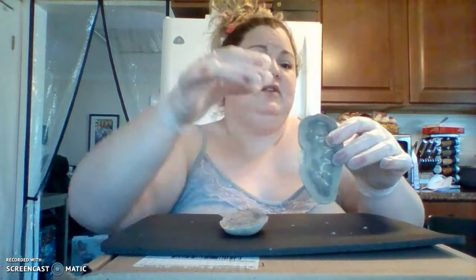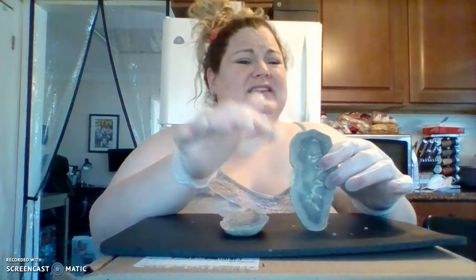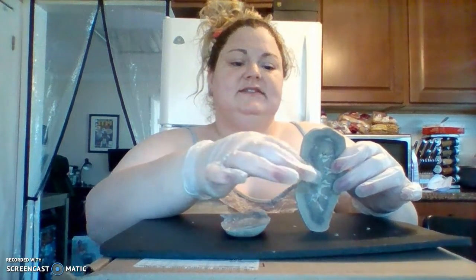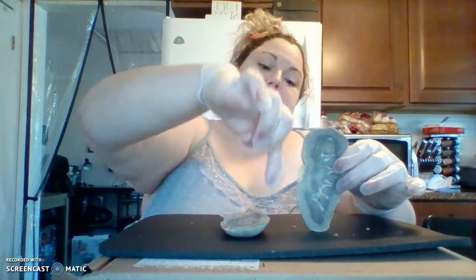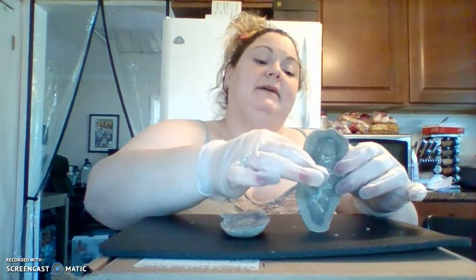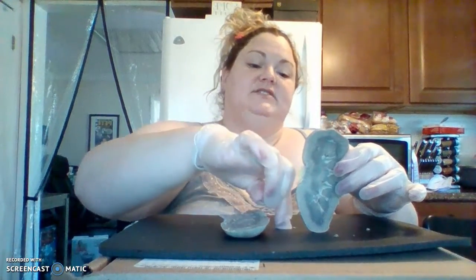I'm just not really quite sure if I cut deep enough to actually locate it, and then I was afraid to cut to ruin it. Now we also have our major calyxes, which would be running down right up to the top before into the ureter, which would be coming down over here. And so we have our minor and major calyx, which then runs into your renal pelvis and down into your ureter.